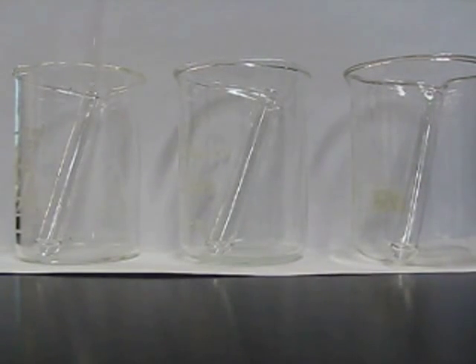In each of these beakers is a test tube, and in each test tube is one of the alcohols for experiment 4: either 1-propanol, 1-butanol, or 2-butanol.